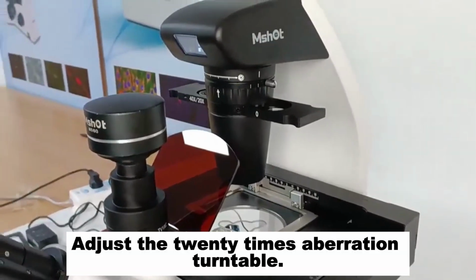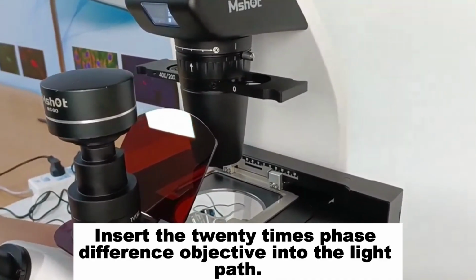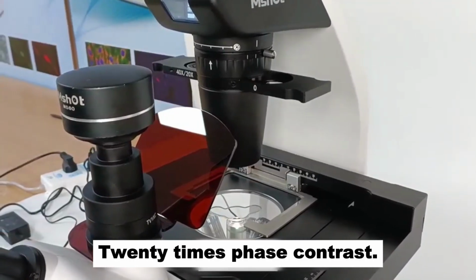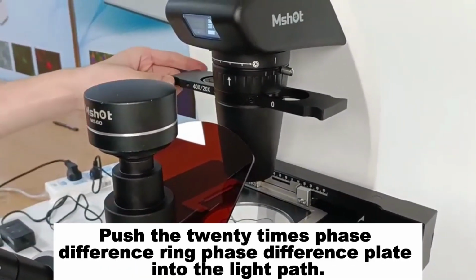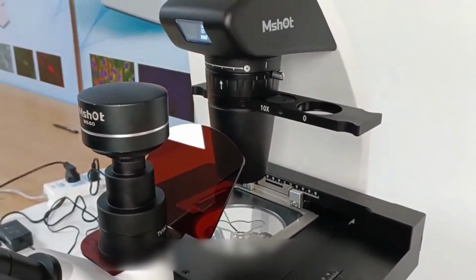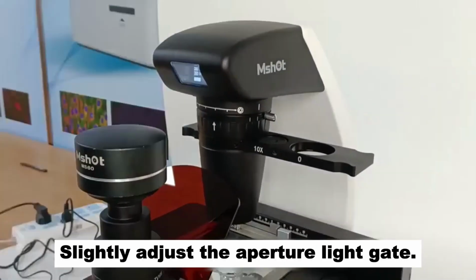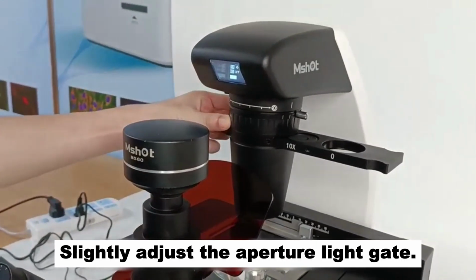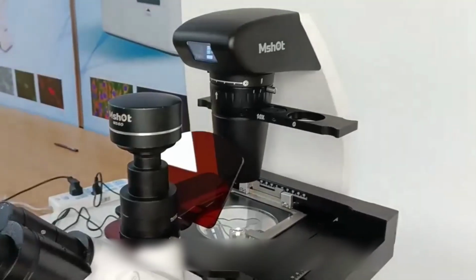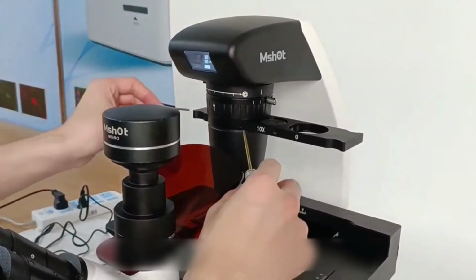Adjust the 20 times phase contrast turntable. Insert the 20 times phase difference objective into the light path. Push the 20 times phase difference ring, the phase difference plate, into the light path. Slightly adjust the aperture light gate. Adjust concentric circles in the same way.